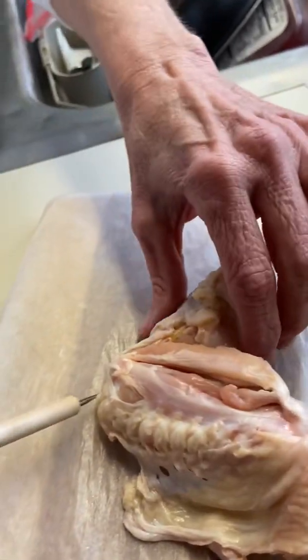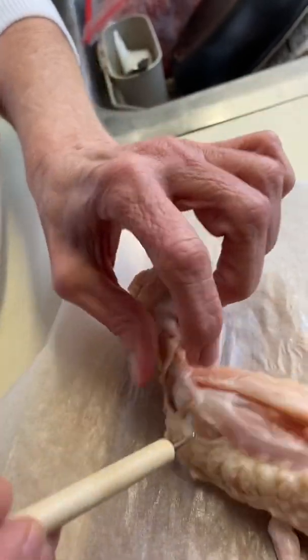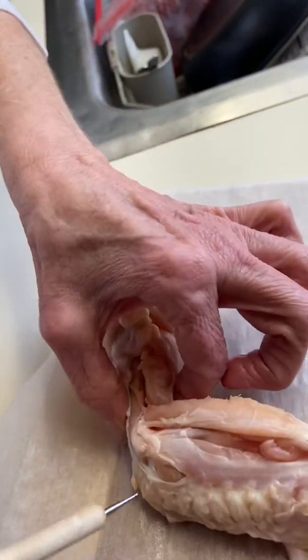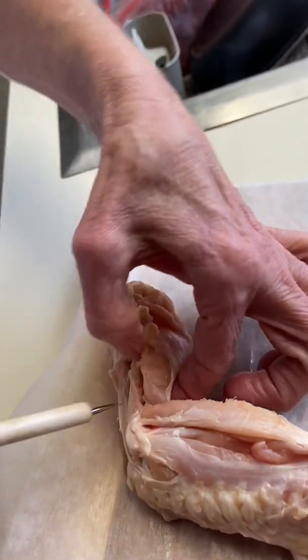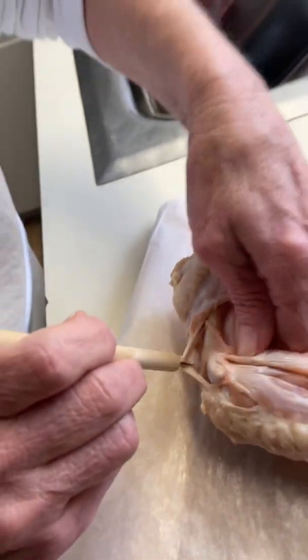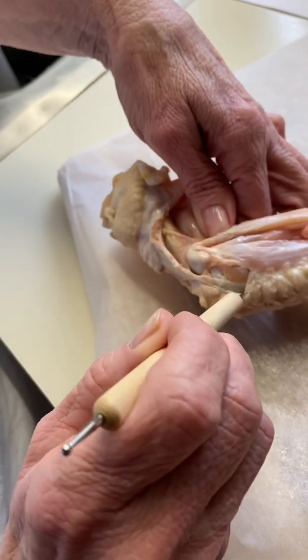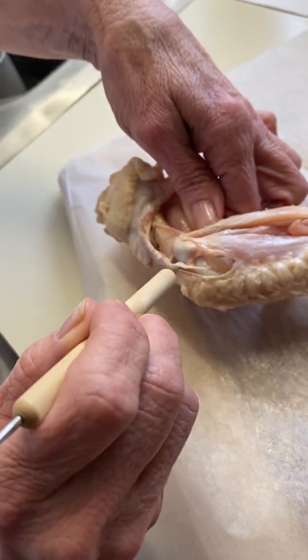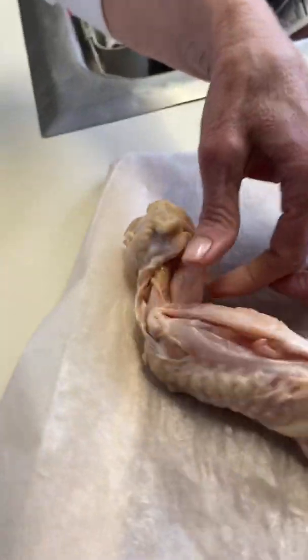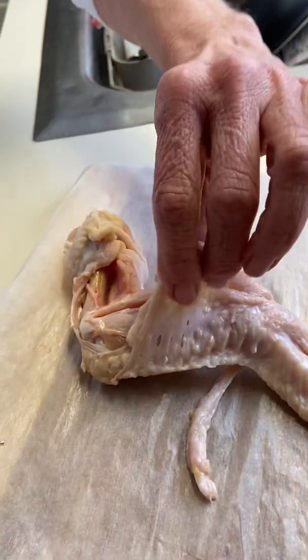Next, to identify our ligament, I'm just going to change the position of my chicken wing here so that I can get down in here and pull the ligament out, which is another cord-like material, but the ligament actually connects bone to bone here. See if I can get a better example here. You can see here that it's running right along here, connecting bone to bone, and it comes right up to this attachment.